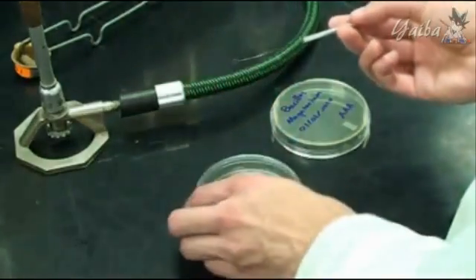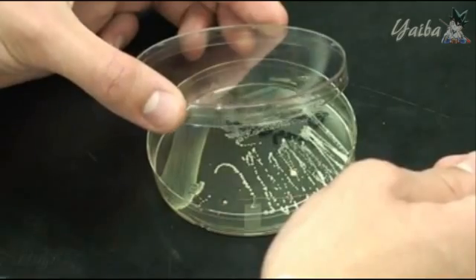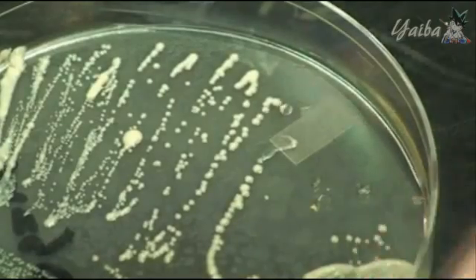Every time you flame the loop, it will be very hot. You can test the temperature by touching the loop to an empty space on the agar. If the loop isn't allowed to cool, the bacteria transferred will surely die. When taking bacteria cultured on a plate, select cells from only a single colony.